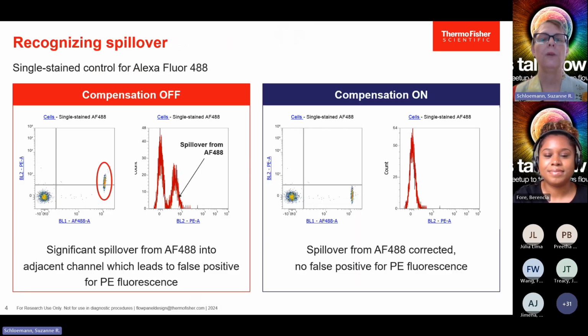So how do we recognize spillover and compensation? The best way to recognize it is to actually run your compensation samples as samples in the experiment so that you have more functionality in the software to look at the data. With the compensation off, a single color control for Alexa Fluor 488, you can see that it's spilling a little bit into the blue laser 2 detector. What this means is that these cells right here are false positives, false PE positives.